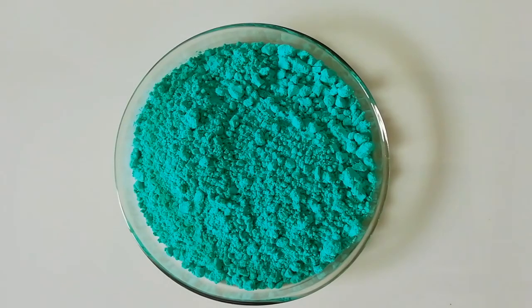After drying the product, this is how our final copper citrate looks. Now to get pyrophoric copper, we need to decompose this copper citrate. Let's go for that reaction.